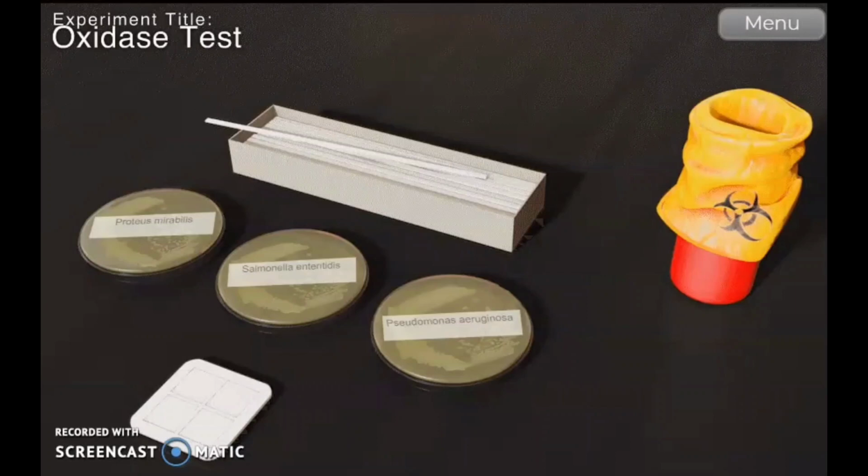They may respire using other oxidases in electron transport. Bacteria generally characterized as oxidase positive include Neisseria and Pseudomonas. Genera of the Enterobacteriaceae family are characterized as oxidase negative.